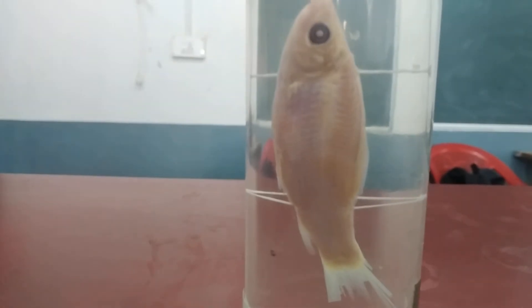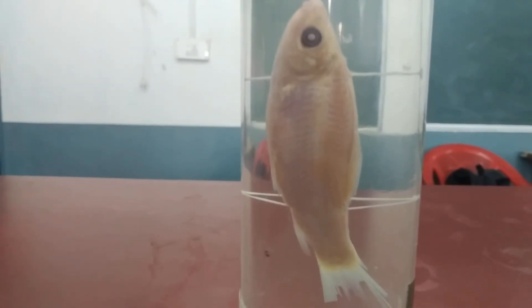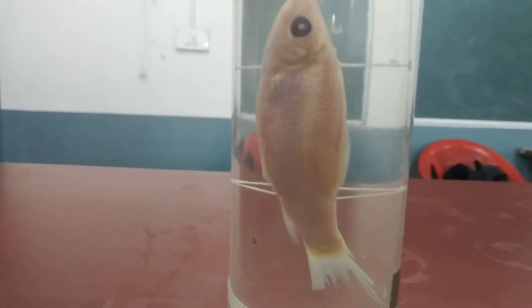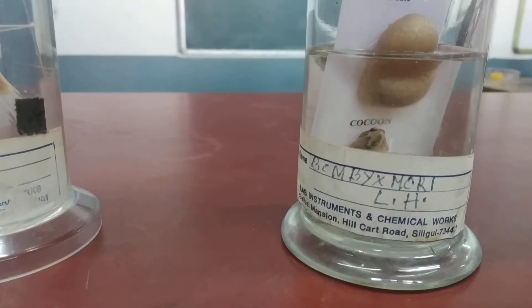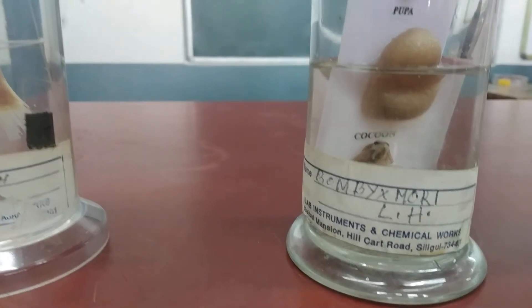Next is the rohu fish. Just look at the structure of the fish properly — it is spindle-shaped and its body is divisible into head, trunk, and tail.